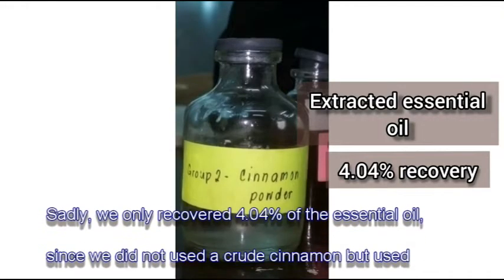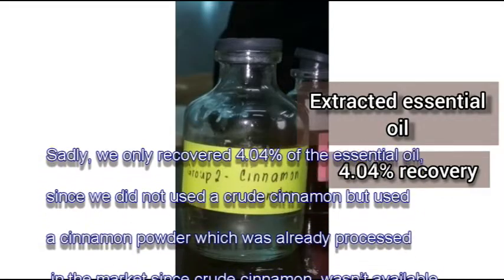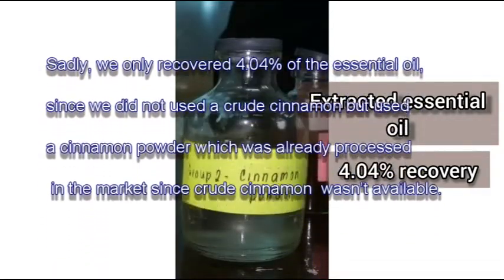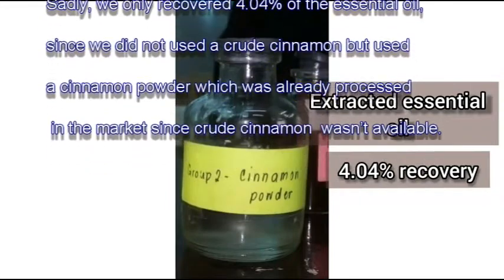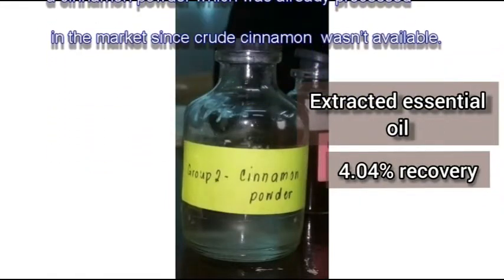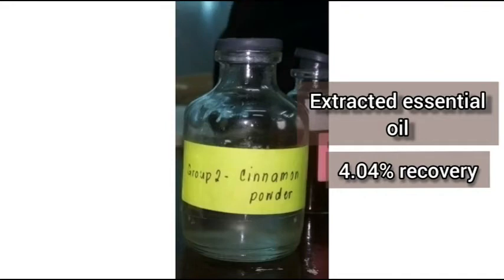Sadly, we only recovered 4.04% of the essential oil since we did not use crude cinnamon but used cinnamon powder which was already processed in the market, since crude cinnamon wasn't available. Thank you.